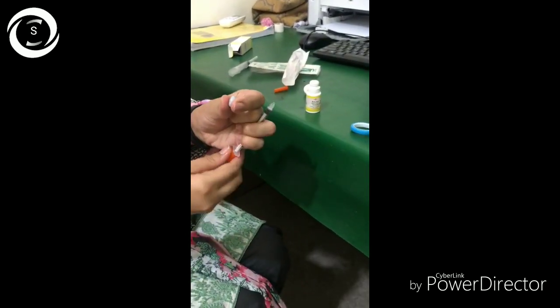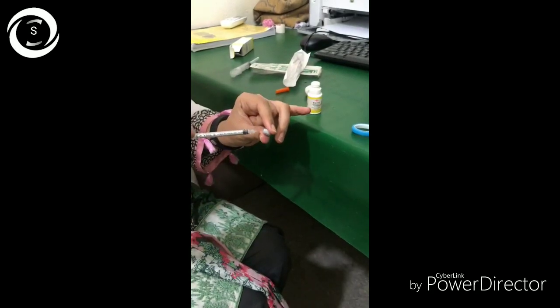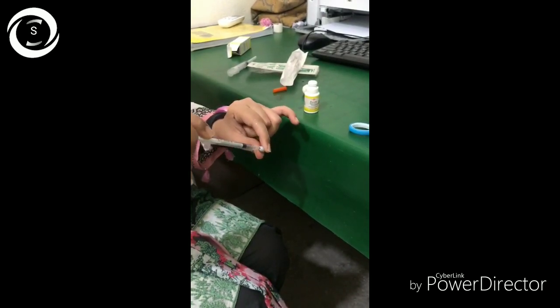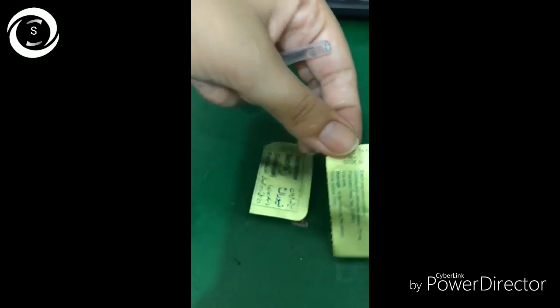Making it in castor oil provides an extra benefit for the deficiency of the lipid layer in dry eye patients. Use this solution for one week — not more than one week — then discard it and make a fresh one. It will raise the goblet cell density.